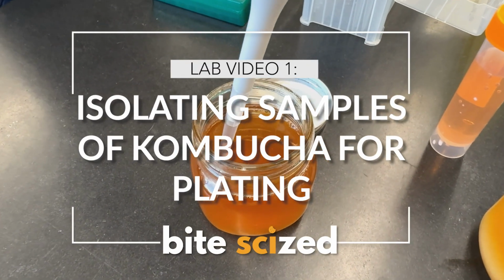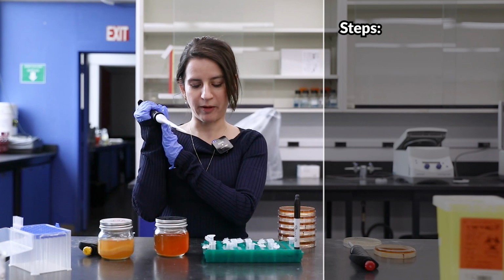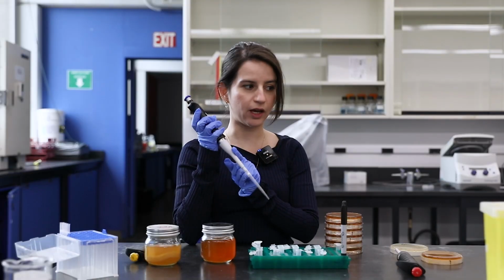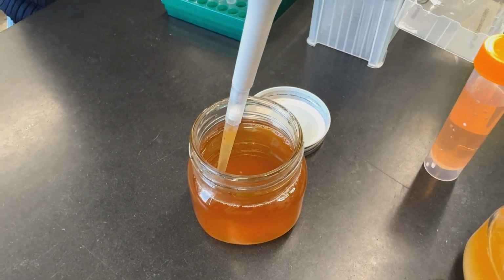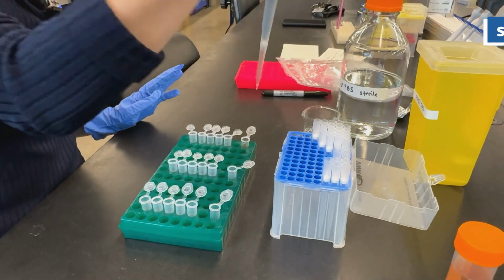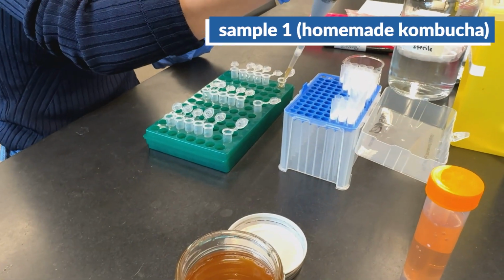Here we took samples from 3 different kombuchas. Using our micropipette, we're going to take a small sample of the kombucha and add it to our tube. This is a micropipette, and they come in different sizes based on how much liquid you want to be transferring, but these are very, very common tools that are used in a scientific laboratory. They're very similar to the pipettes that you might be used to, except they're much more precise and a little bit pricier too.